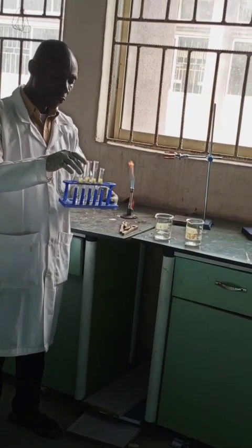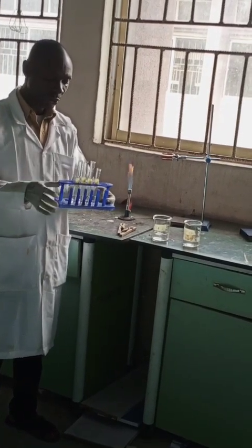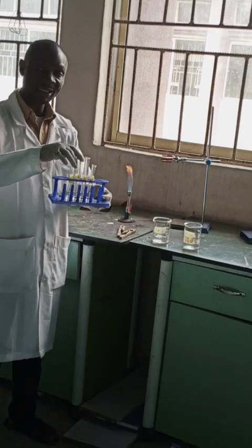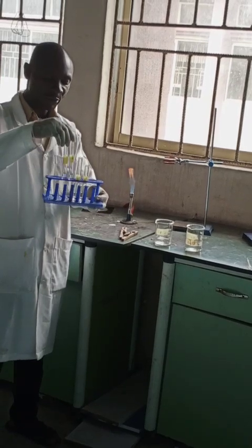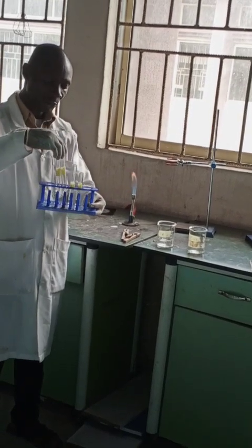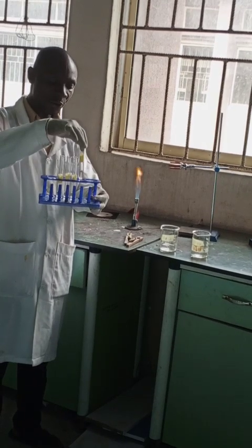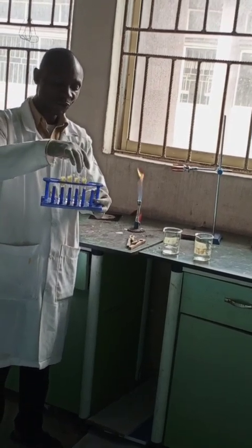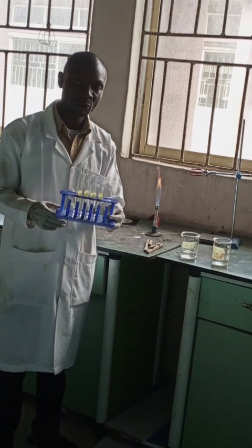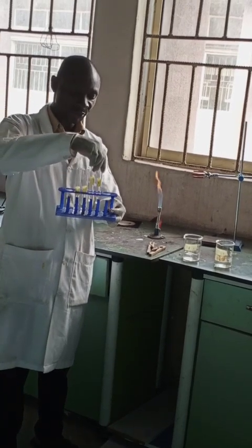Test tubes 1 and 2 contain acetic acid solution 3 mL, while test tubes 3 and 4 contain sodium hydrogen carbonate solution, which is the base solution, 3 mL.